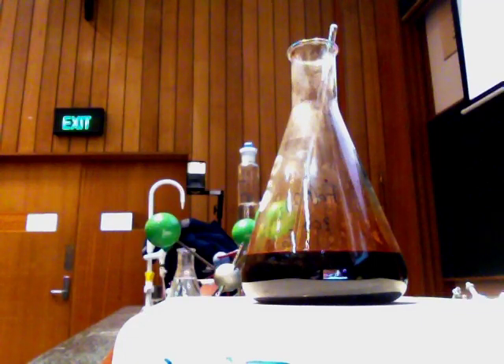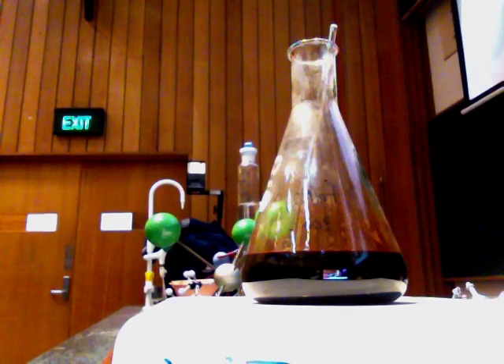Transition metals tend to like sulfurs and nitrogens — this is exactly the kind of thing seen with amino acids. The last thing I'm going to do is add a load of fluoride. I've got sodium fluoride, so I'm going to add F minus. The F minus is going to replace the thiocyanate. Now I have iron 3+ surrounded by 6 F minuses, so the charge on the complex is 3 minus.